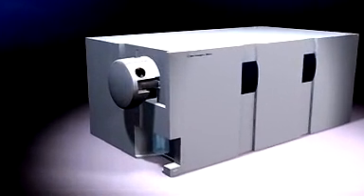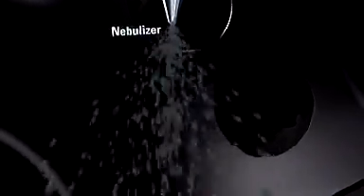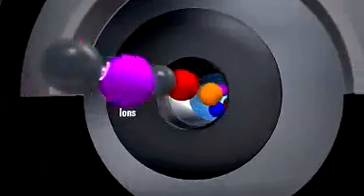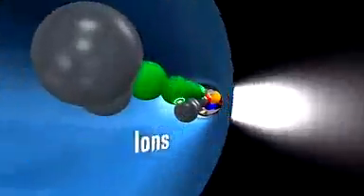Great sensitivity starts with superior ionization technology. Agilent's LC-MS ion sources use patented nebulization technology and high-volume counterflow drying gas. Together, they reduce noise related to incomplete drying of solvent droplets and keep the sampling capillary and ion optics cleaner for reduced maintenance.